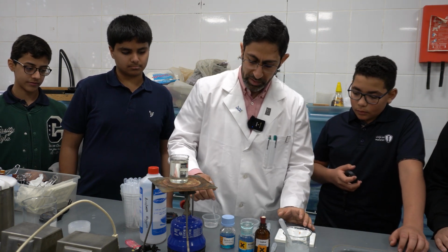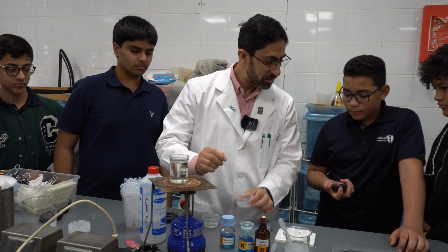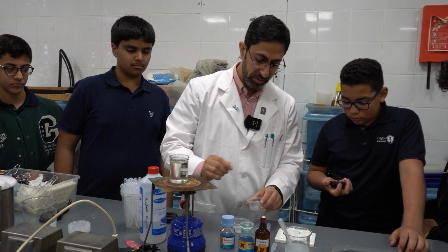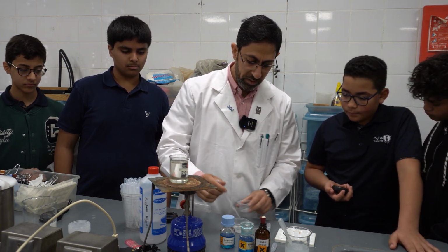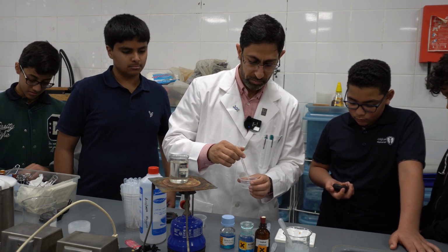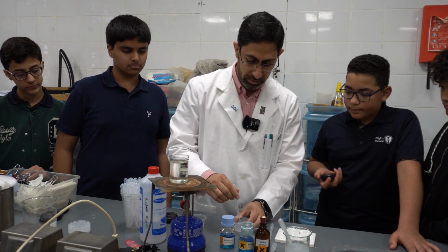So let's carry on. When I say go ahead, you will. Now I'm adding the enzyme. After 30 seconds, tell me when the time comes. Don't stop it. When it comes to 30 seconds, just tell me. I'm adding an equal amount, and I will start stirring in order to mix the solution. It's 30 seconds. Okay, that's great.